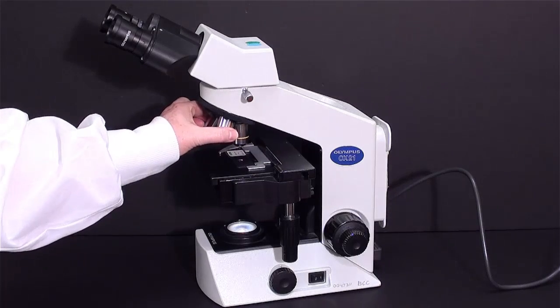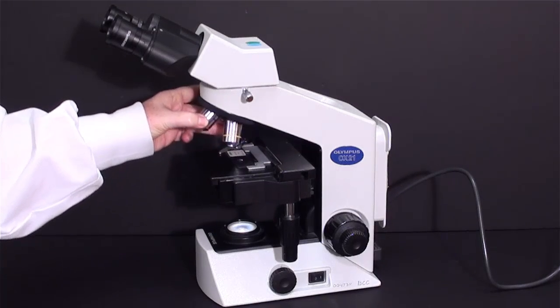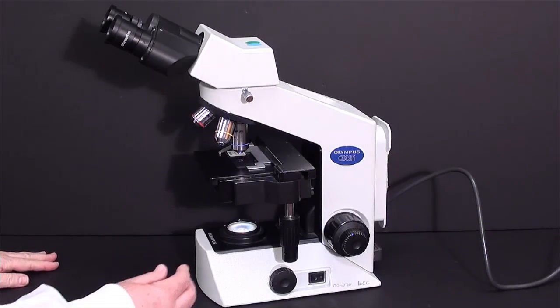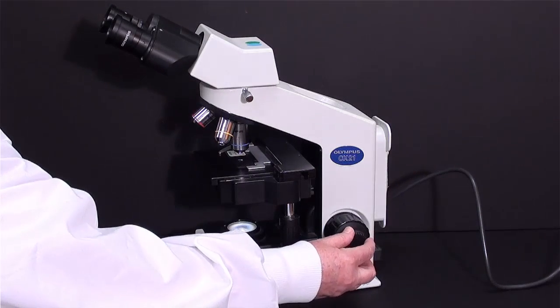Now you can change the magnification one more time if you need to. Again, fine focus only.